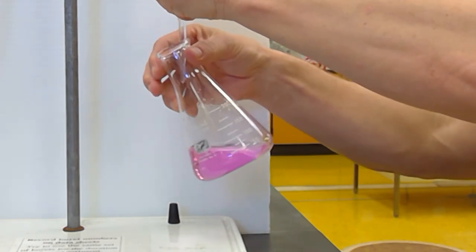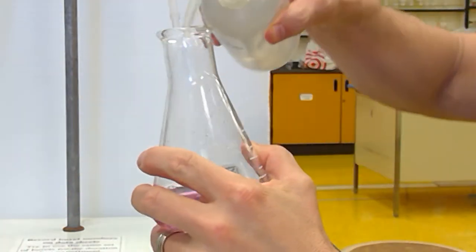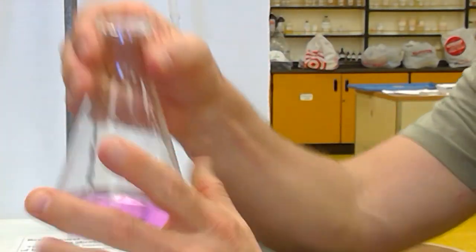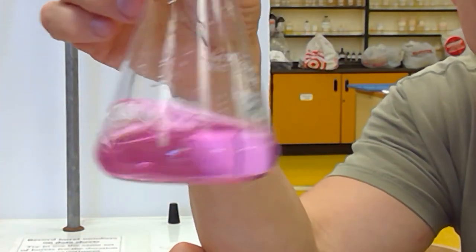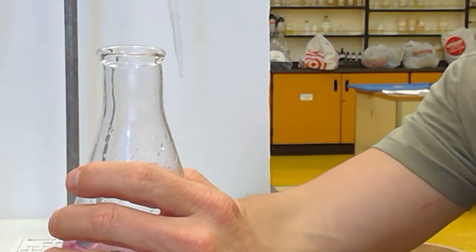I got a drop hanging off, so I'm going to tap that drop off on the inside neck of the flask. And what I'm going to do is get that droplet down there, so I'm going to spray. Adding water does not change the moles of acid or base. So that's way too pink, obviously. If you can hold it up and see it's too pink, right?